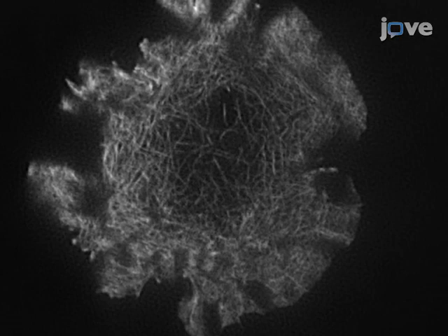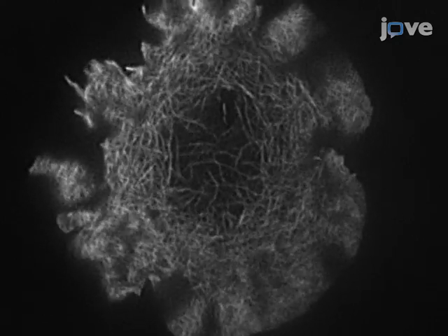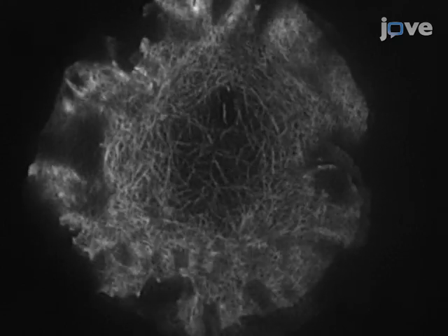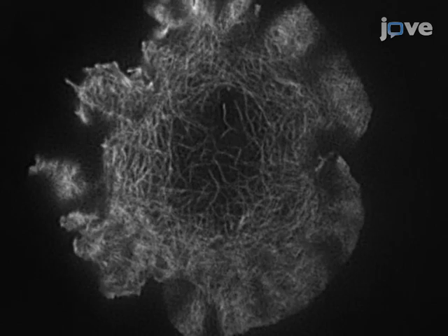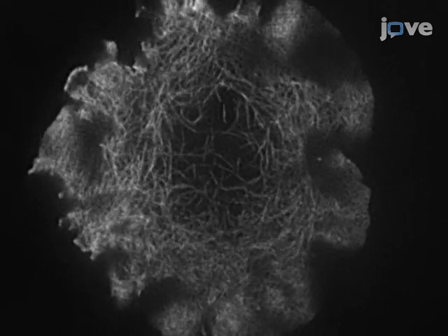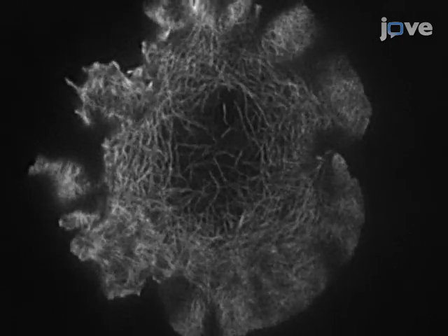Shown here is a Jurkat T-cell expressing GFP-labeled F-actin, which was imaged with the TIRF-SIM protocol discussed in the text. 5 minutes after this cell was introduced onto a cover slip coated with anti-CD3 and anti-CD28 antibodies meant to stimulate the formation of immunological synapses, a time course was taken of it so that the molecular flow of F-actin could be visualized.